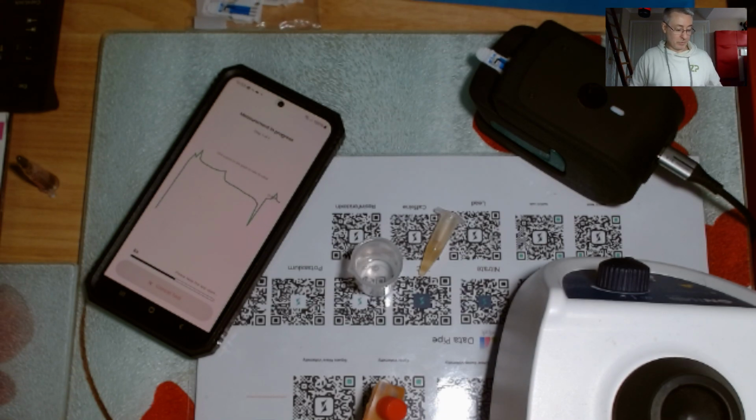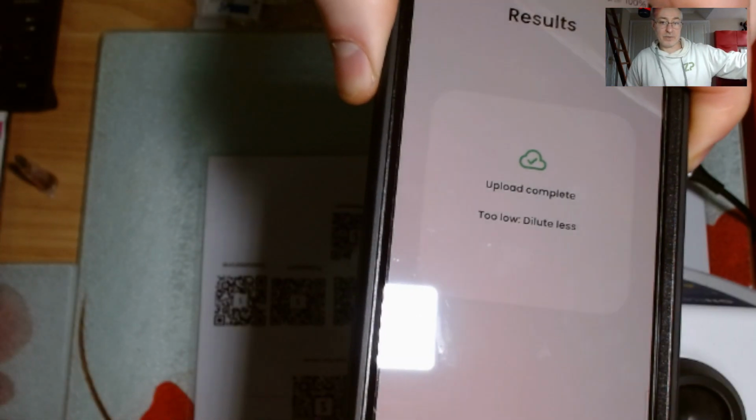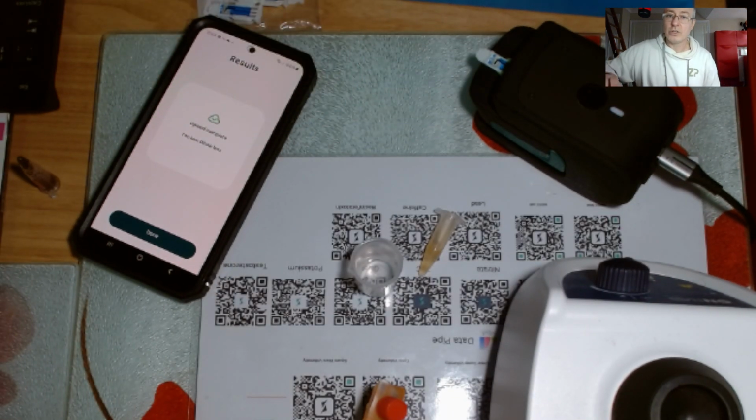You won't be too surprised by the message that I get. So it's processing it, right? Okay, so what does it say? It says upload complete, too low, dilute less. So it was the same message as last time, but when you get these messages, rather than just accepting them as is, you can actually do a little bit of investigation. So again, I'll just share my screen.